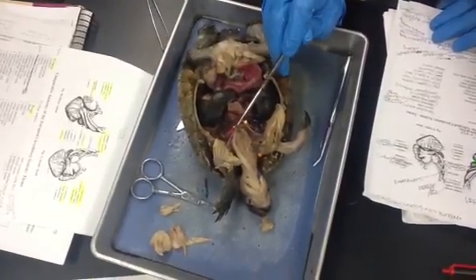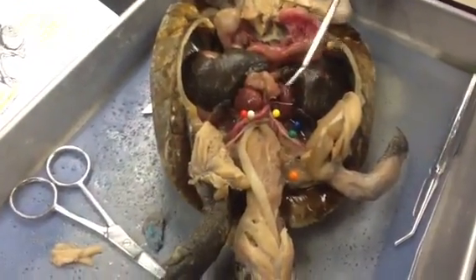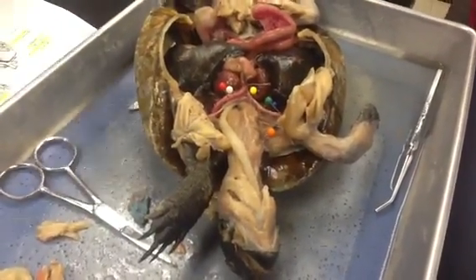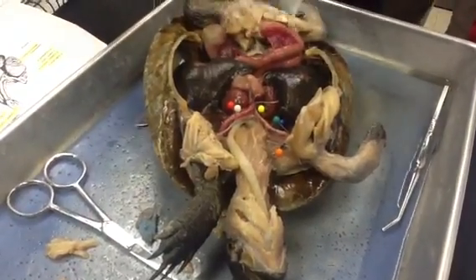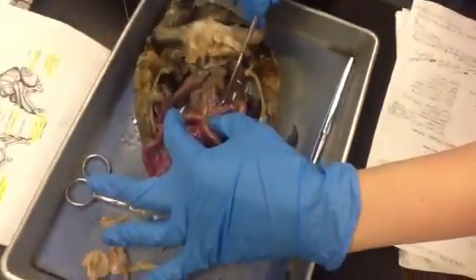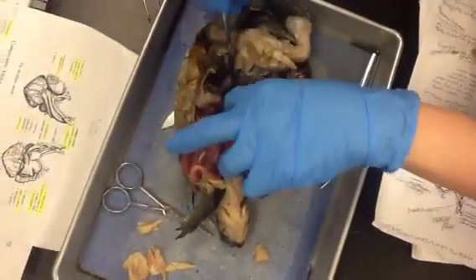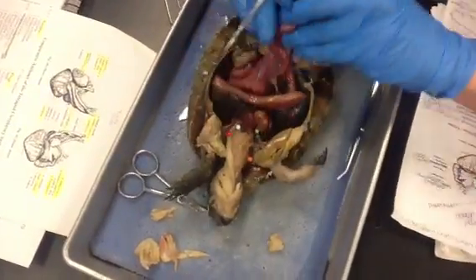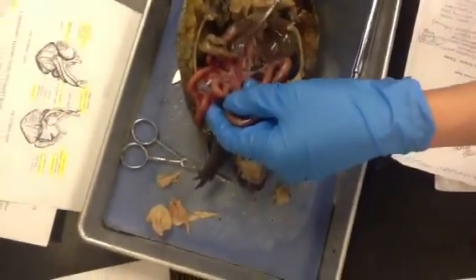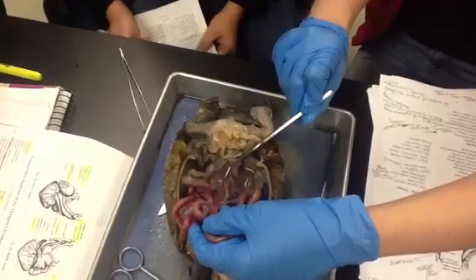Red over here is the left systemic trunk — this thick pink one right here is the left systemic trunk with the red pin. The left systemic trunk leads to the left systemic arch. And then both arches come down and combine to make the dorsal aorta, which is underneath here. You can see where they come together — there are actually two of them. The left systemic and right systemic arches come down and meet up for the dorsal aorta.